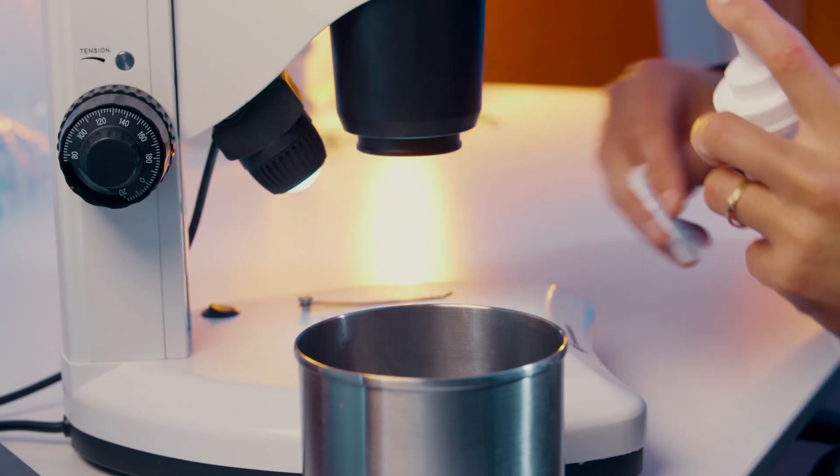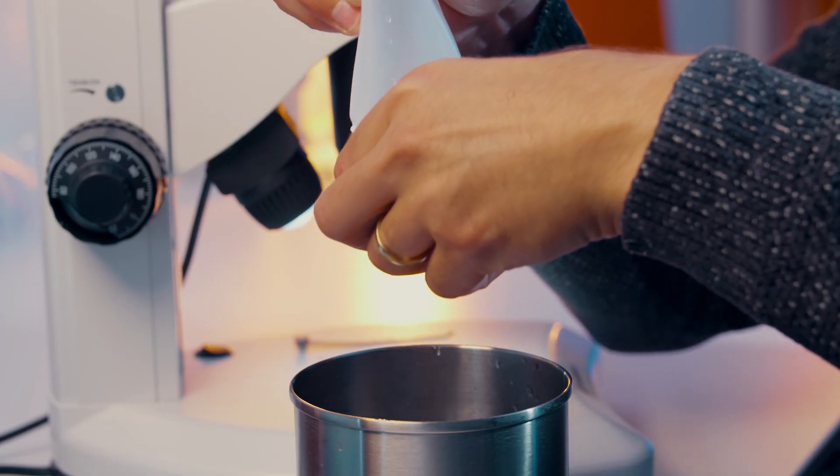I got here a highly advanced cotton pad. I just want to show you the clean version. So we're here now on the lowest magnification. There's not much going on — it's pretty clean. So what we do now, we take this clean filter and just let all the liquid flow through.